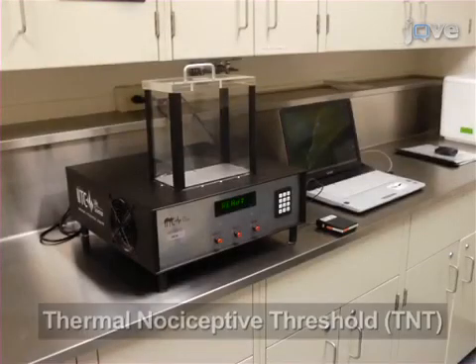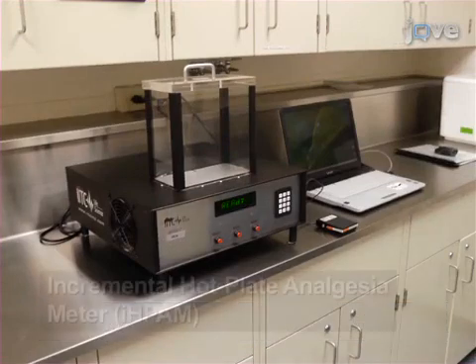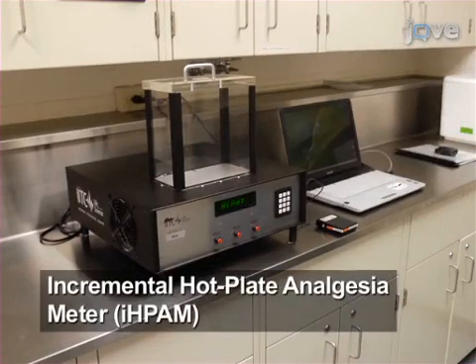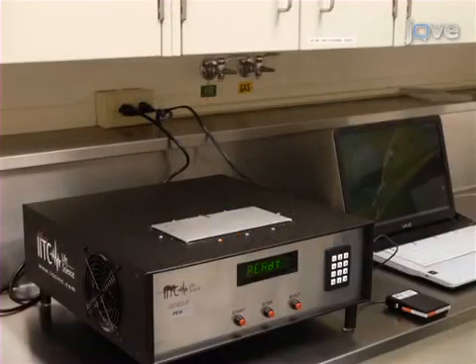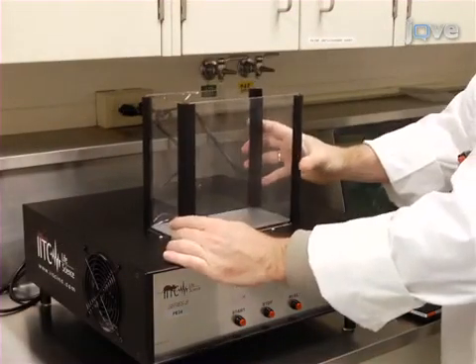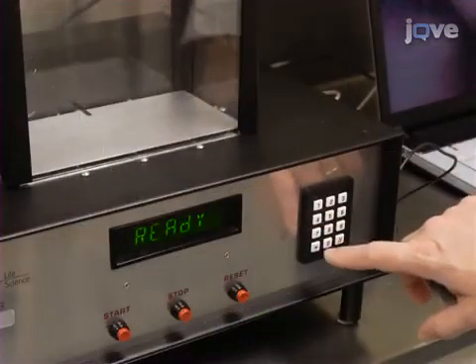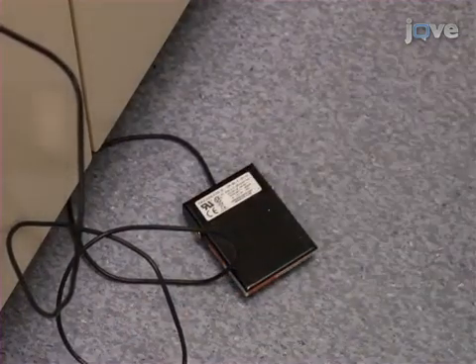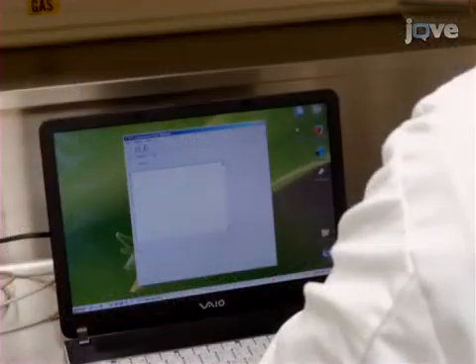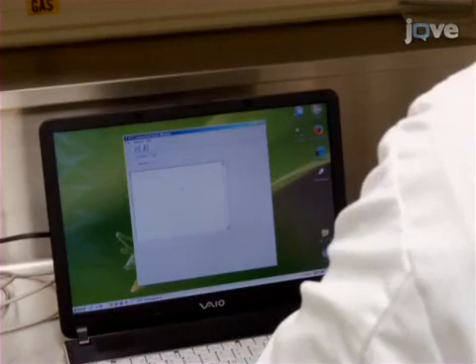The thermal nociceptive threshold, or TNT, is determined using the incremental hot plate analgesia meter, or IHPAM. The components of this system include a plexiglass observation chamber, a temperature controlled aluminum plate, a keypad used for programming, and a foot switch for remote control of the unit. Data are collected using customised software on a nearby computer.